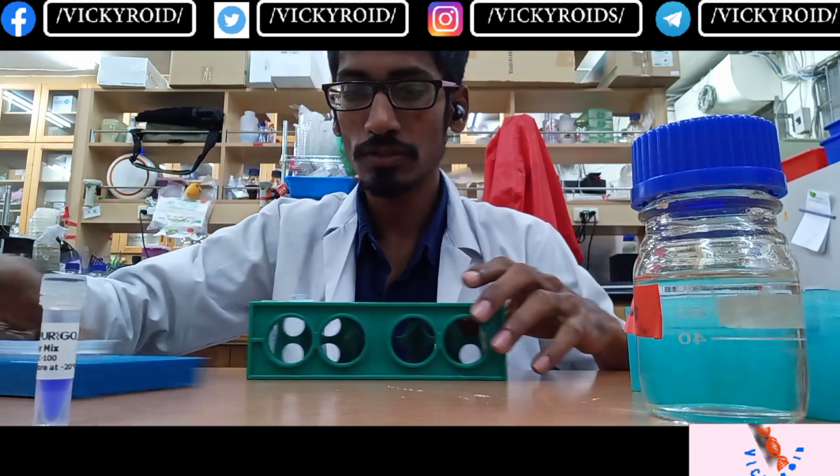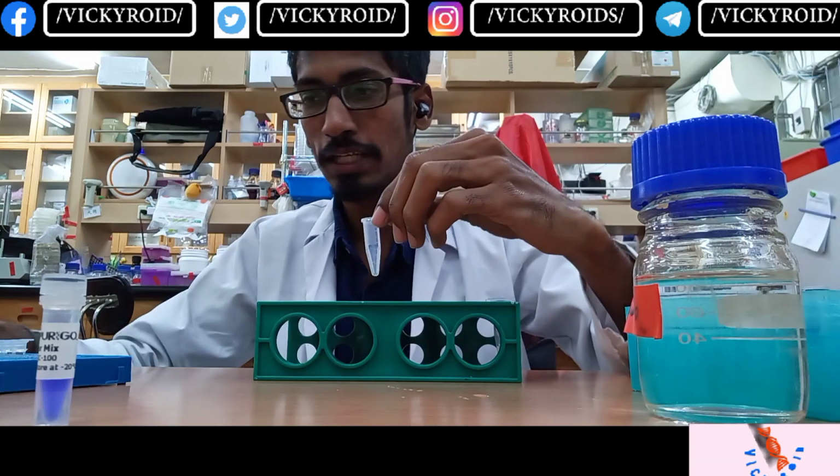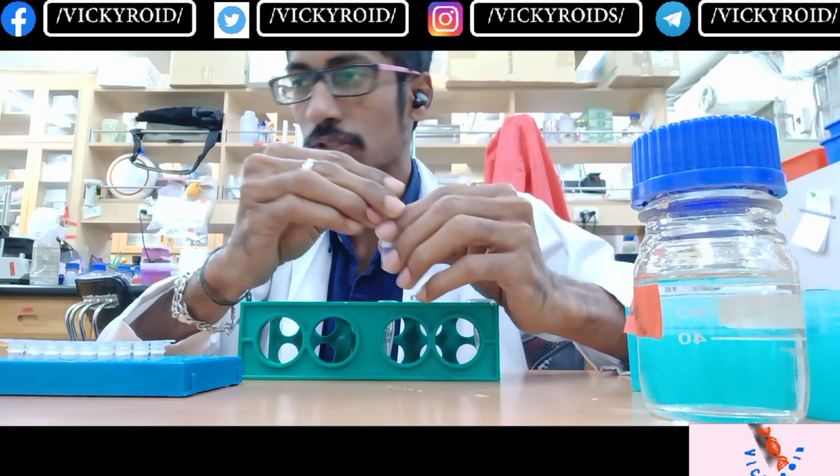I'm going to make the mixture for all 17 samples, so that later I can add the mixture from this tube to each of the other tubes. I have already made the calculation for the 17 bacterial DNAs. I am going to prepare the master mix. For 17 samples, I'll be adding 10 microliter each, so I'll add 170 microliter of the master mix to this tube.